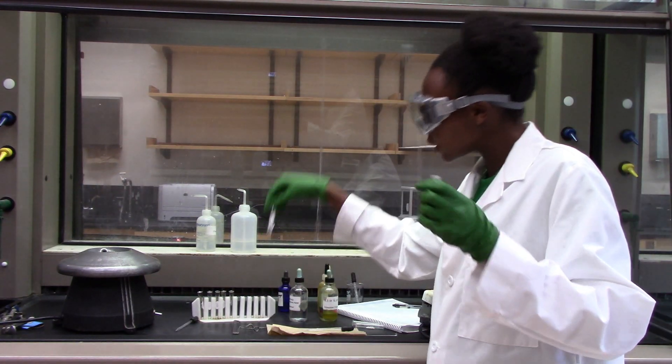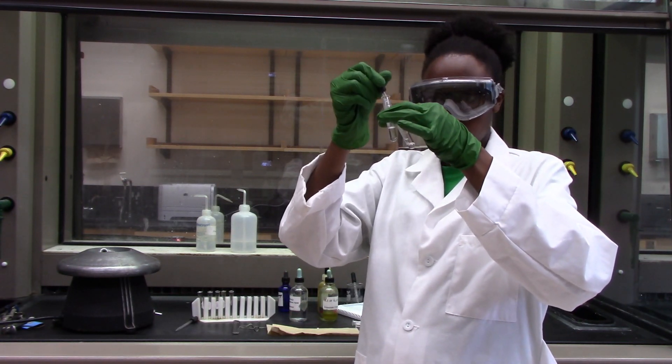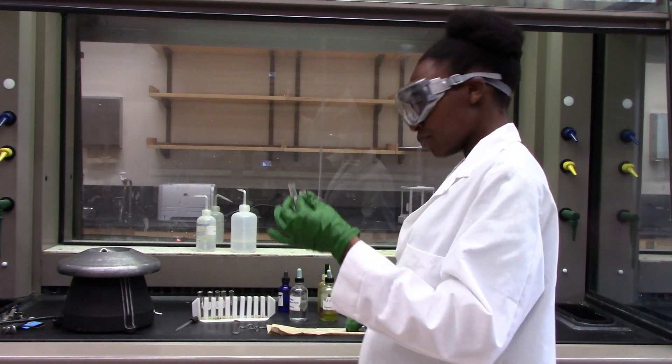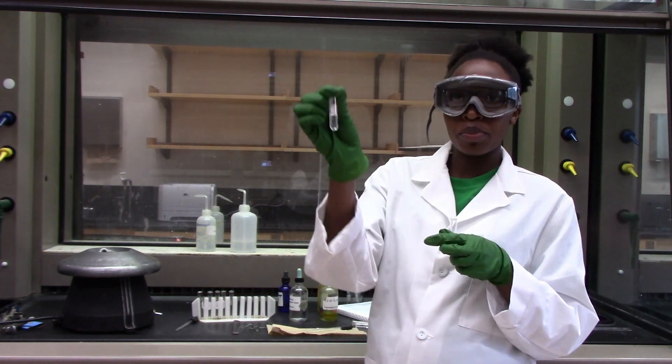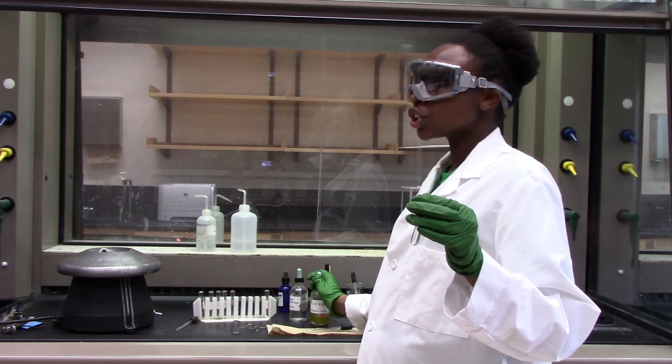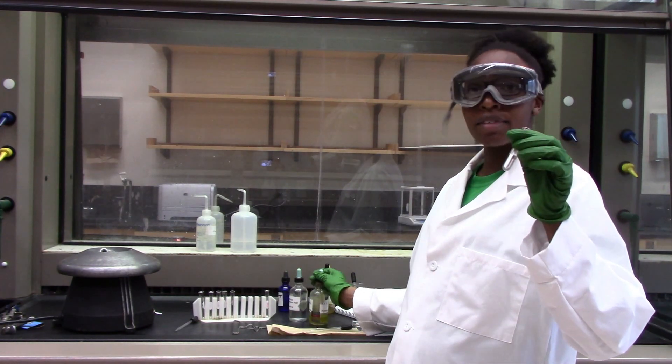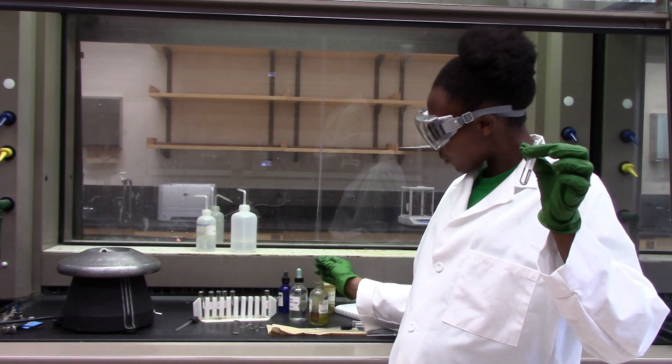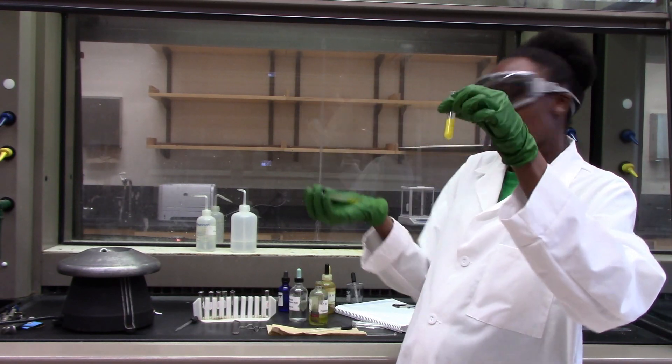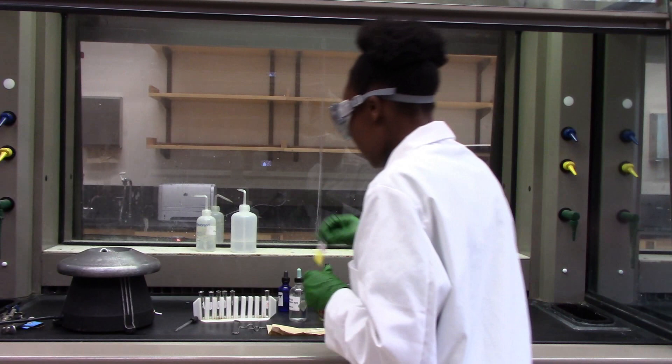So to my supernatant, I'll add the additional hot water that I just added in. Now I have a precipitate and my supernatant, which is a clear solution. I am going to take the supernatant and add two drops of potassium chromate. This is a confirmatory step for lead chloride. If we have lead cations, it should give us a yellow precipitate. Let's see what happens. Well, as you can see here, our precipitate turned yellow.